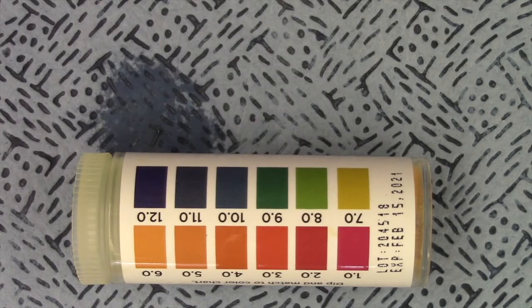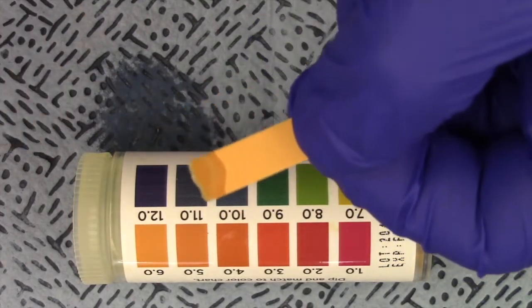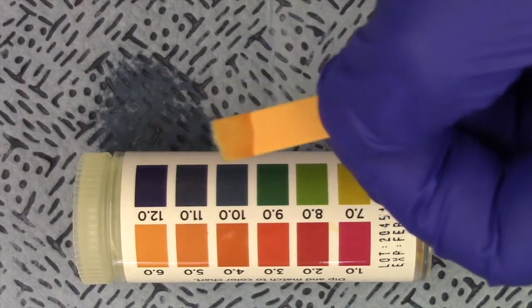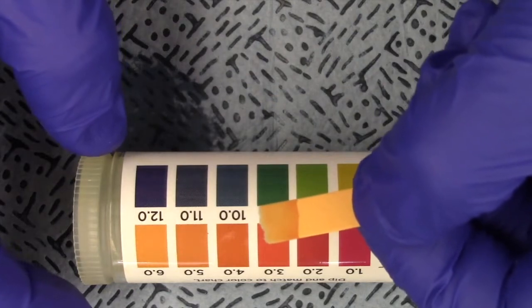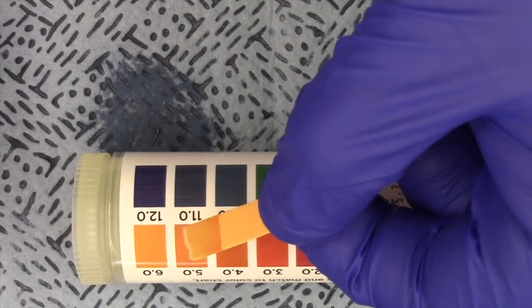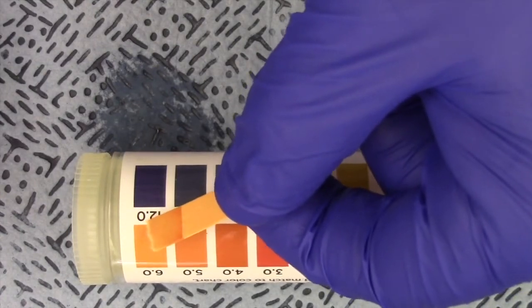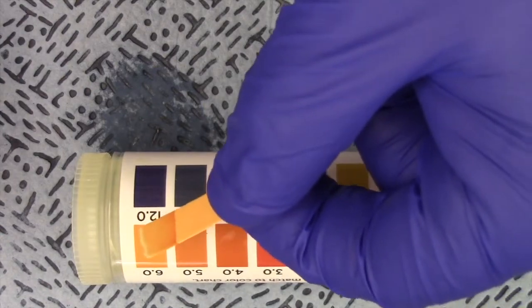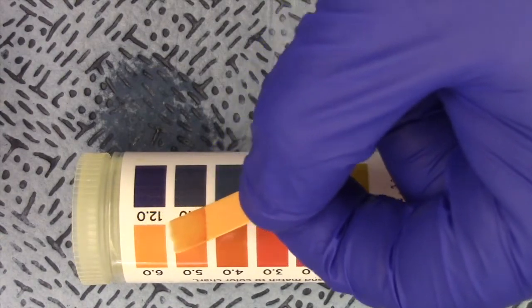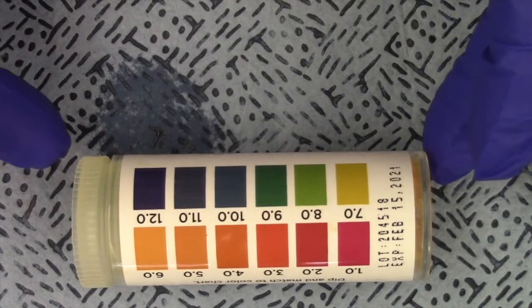All right, next, we're going to test a solution of sodium chloride. So let's just take a little dropper. I'm just going to drop a touch on here. There we go. There's the color change. So now I'm going to take a look here. Nope, nope, nope. Well, maybe, no. It's one of these two, and you're going to have to determine which one you think it is most like. Write that down in your data sheet. That was sodium chloride.